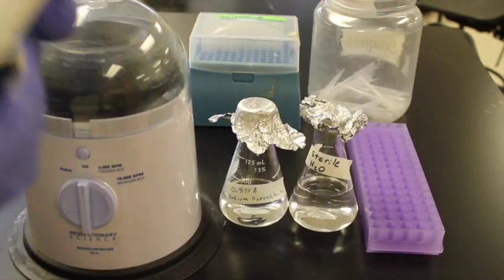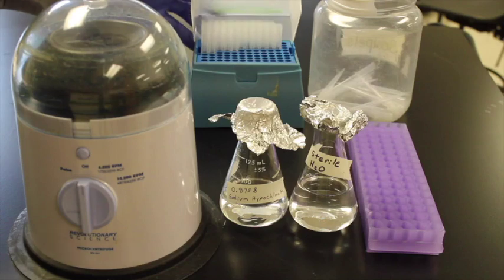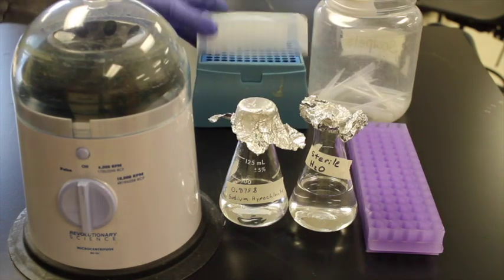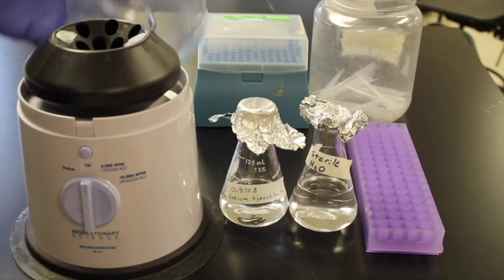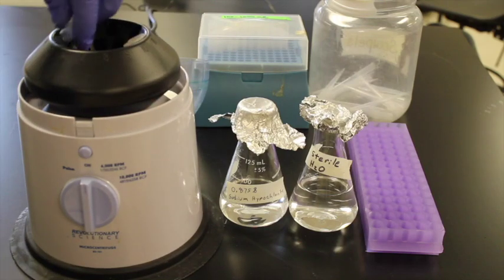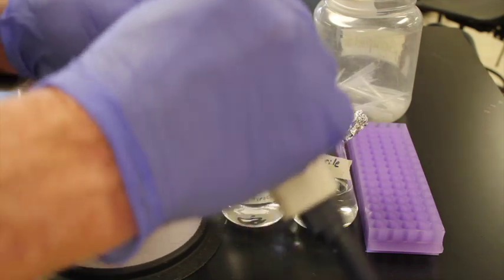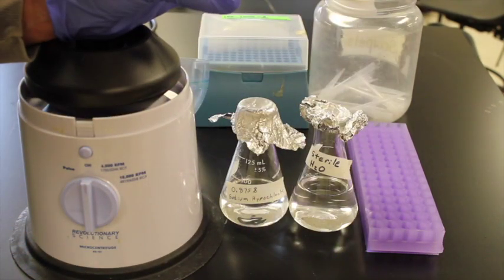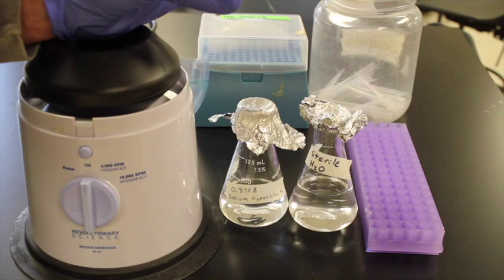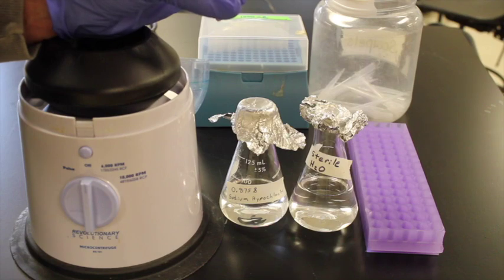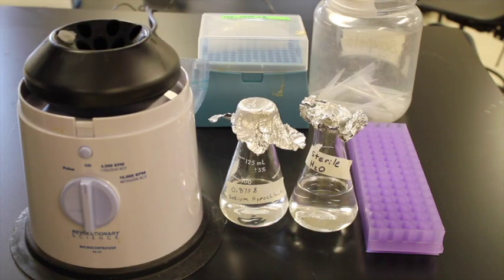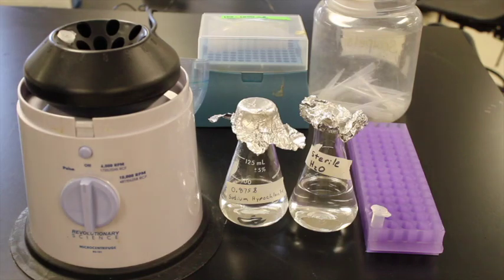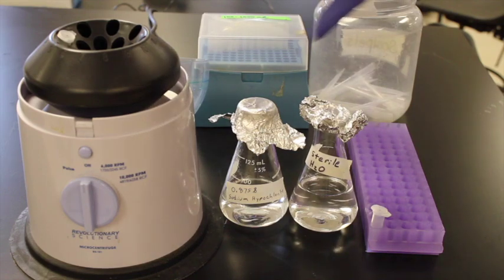Now what I want to do is I'm going to take my pipetter, add a pipette tip to it. We'll open this up and find the one with the spores. I'm going to open that up and carefully I'm going to pipette out all of the water without pipetting up the spores. So I'll put that there and then I will get rid of the water. And now what I need to do is I need to change pipette tips.